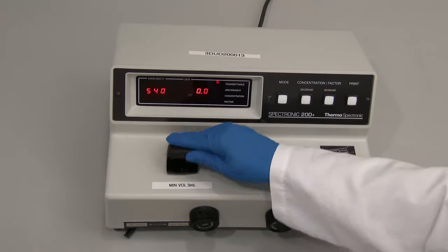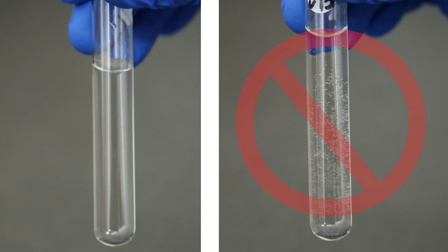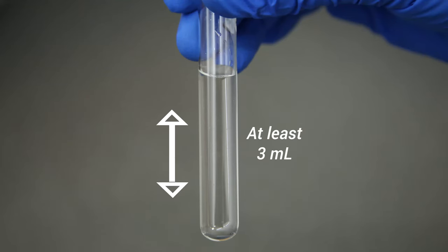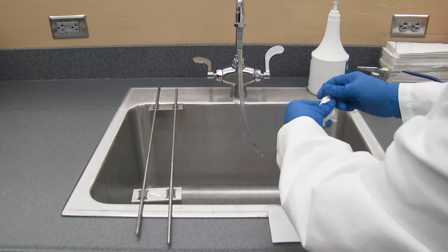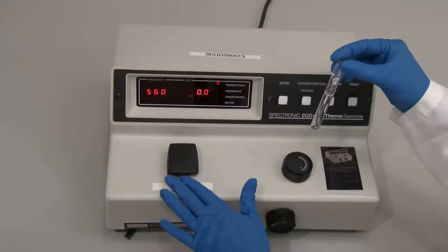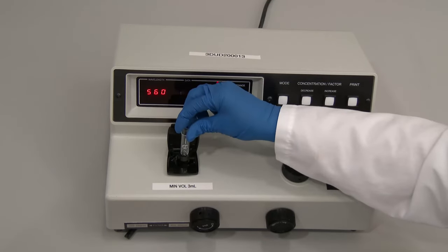Most procedures require the instrument to be zeroed using a water blank or reagent blank to account for the effects of the solution itself. To prepare a water blank, fill a clean cuvette with distilled water avoiding the formation of bubbles. If using a reagent blank, fill a clean cuvette with the designated reagent. Cuvettes should be filled to at least half their volume; the minimum required volume is 3 milliliters. Using a lint-free tissue, gently wipe the outside of the cuvette to remove any surface interference such as fingerprints, dust, or liquid. Insert the cuvette into the sample compartment, align the guide mark on the cuvette with the guide mark on the compartment, and gently but firmly push the cuvette in and close the cover.